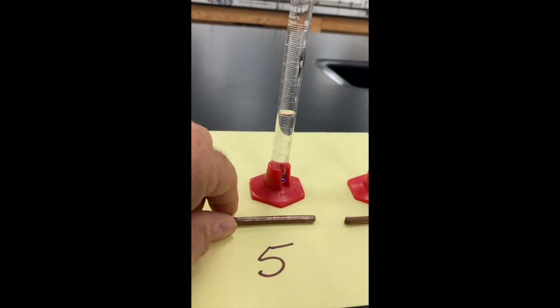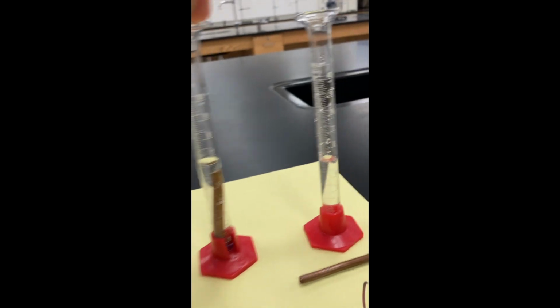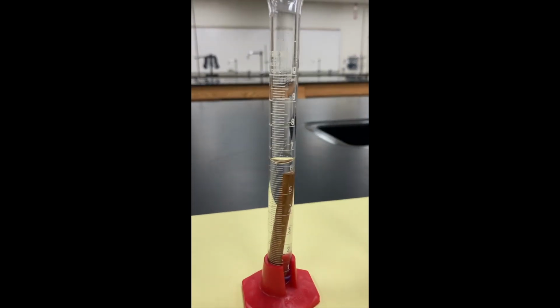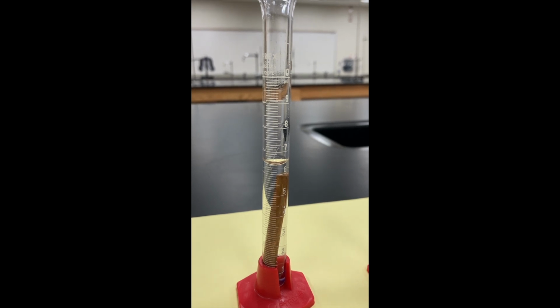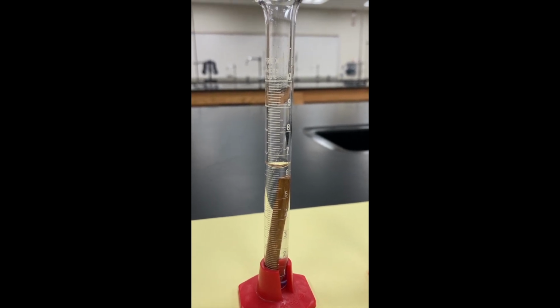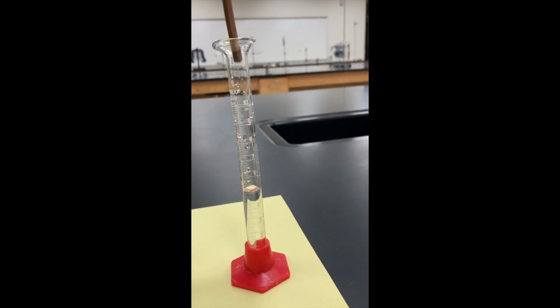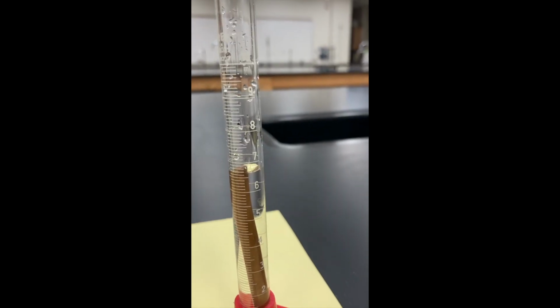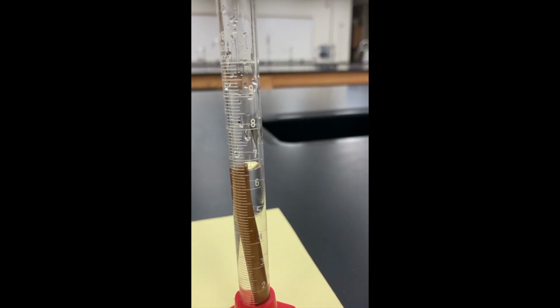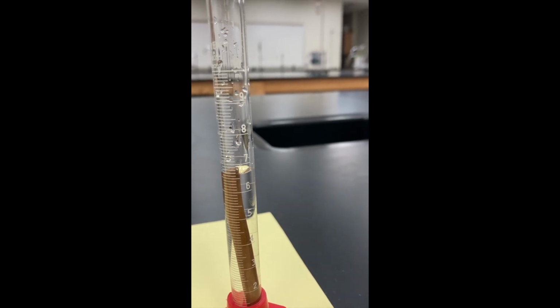Okay, piece number 5. Let the bubbles settle. Here you go for piece number 5. And the last one will be piece number 6. And we've got a new volume there.